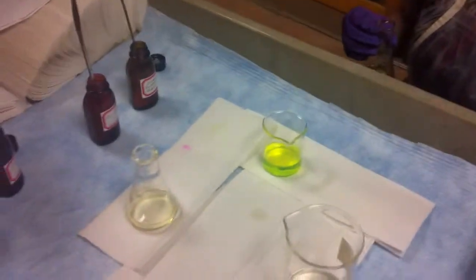Oops. Oh. It's bright and yellow. Kaboom. Yellow, bright yellow screen. That's really pretty. Wow. It lasts a long time. Yeah, it does. But don't worry, we'll come back to these. If we have leftover, we play.